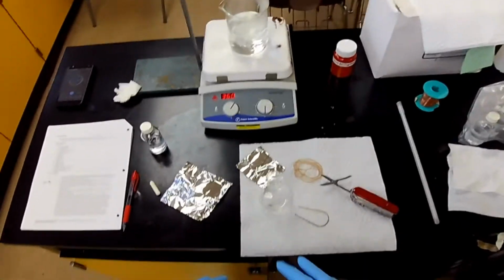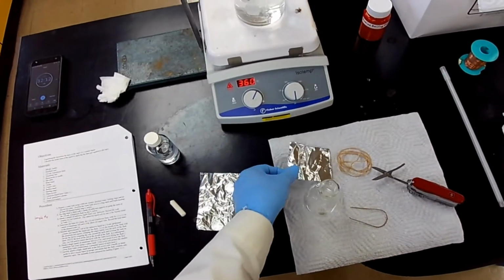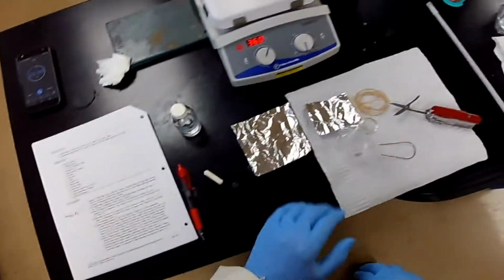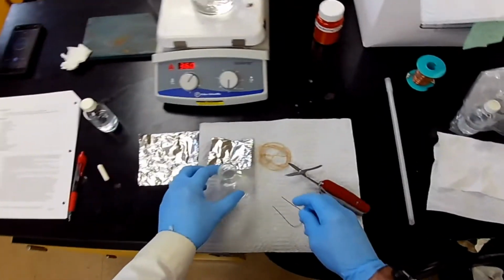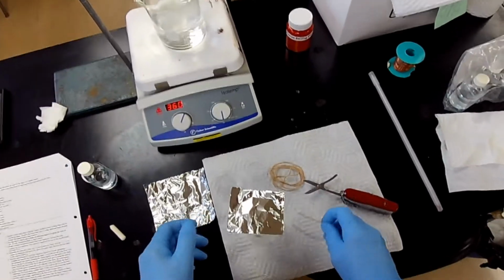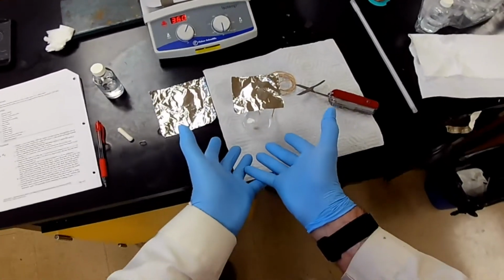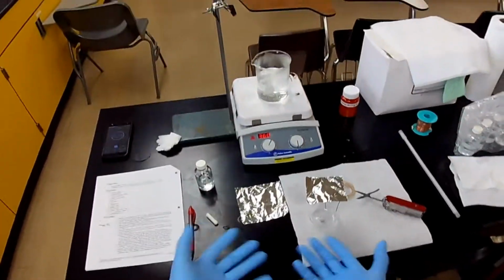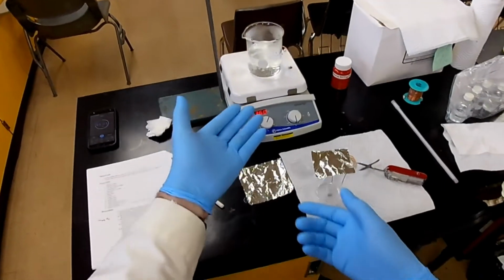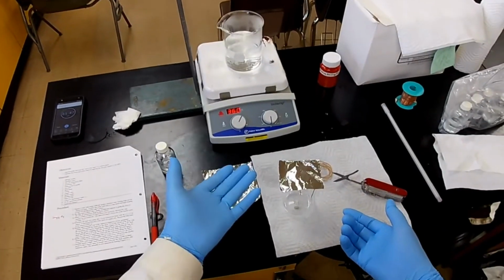Now, why do we need 2 pieces of aluminum? It says a small piece, 2.5 by 2.5 inches, and a 4 by 4 inch large piece. Well, this is the one that we're going to include in the weight, all of that together. That's the weight without the gas. Then we're going to weigh it after the experiment, after the boiling, and that'll be the weight with the gas.